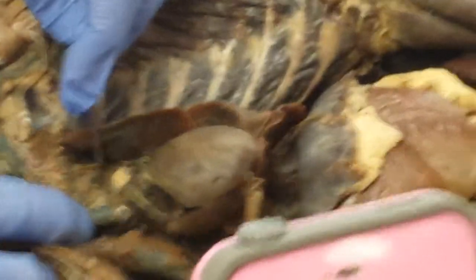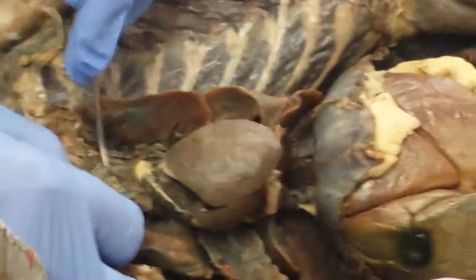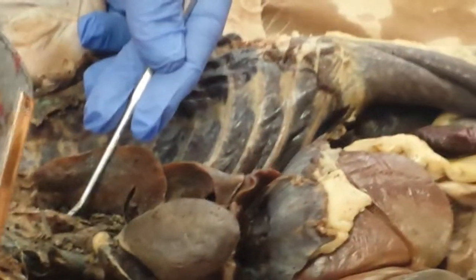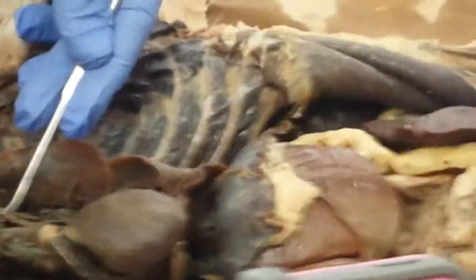Alright, and then the third trunk behind the aorta. Oh, wait a minute. Let me finish the aorta arch here. So we have brachiocephalic. What is the next branch off of the arch of the aorta? Left subclavian, thank you. Then it proceeds on to the left axillary and then left brachial arteries.